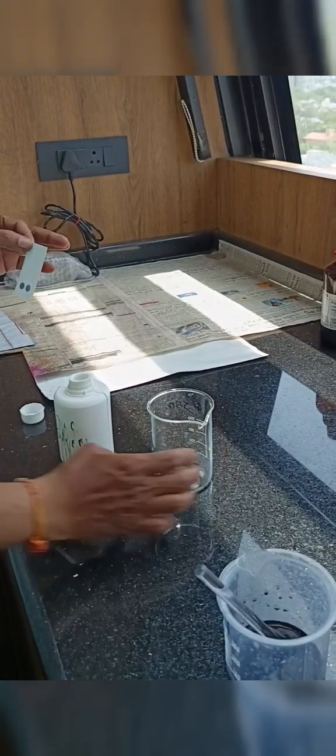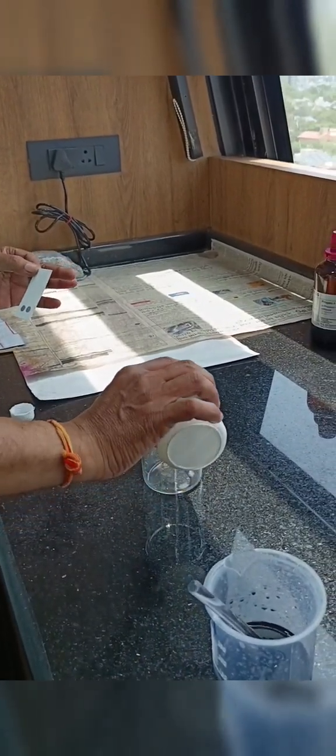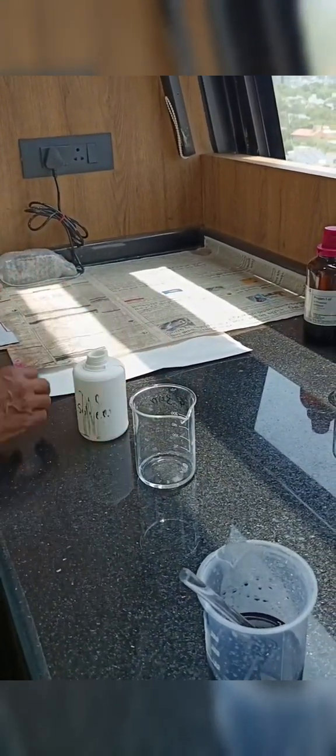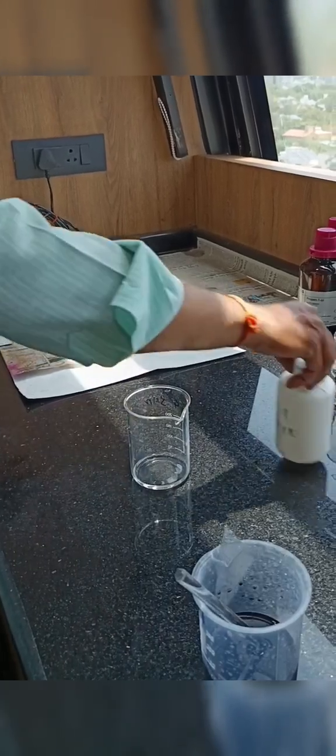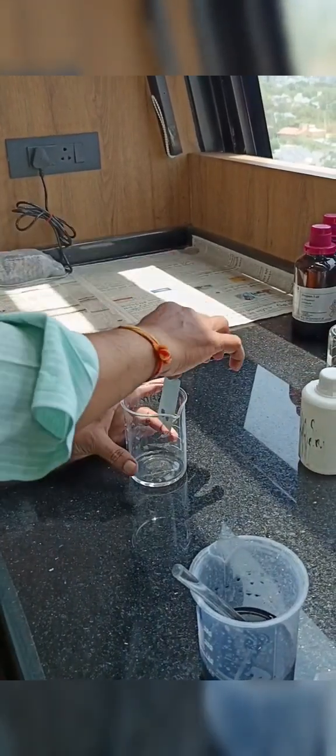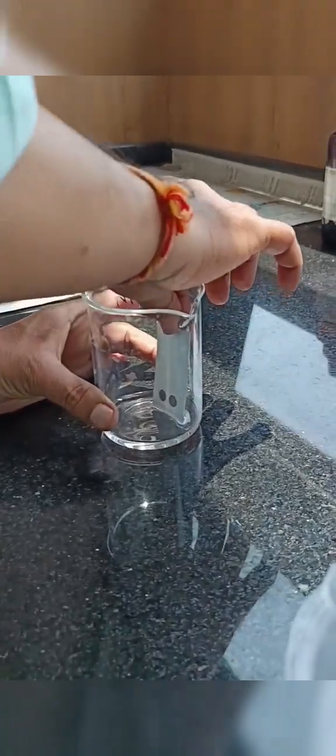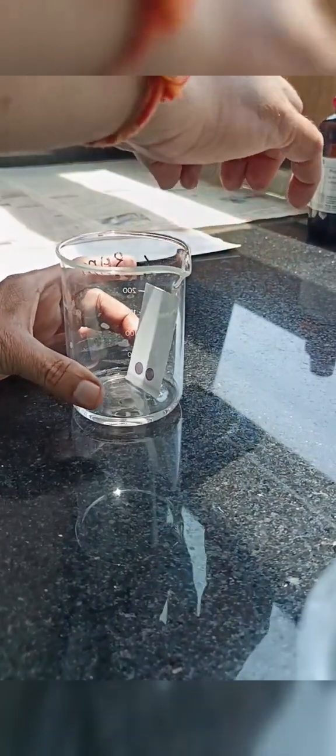Place the TLC sheet into it until it shows different bands.